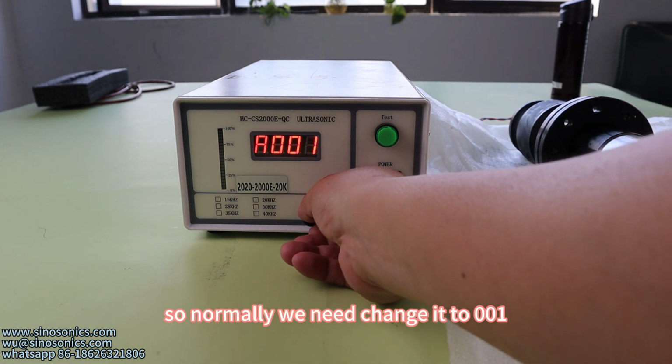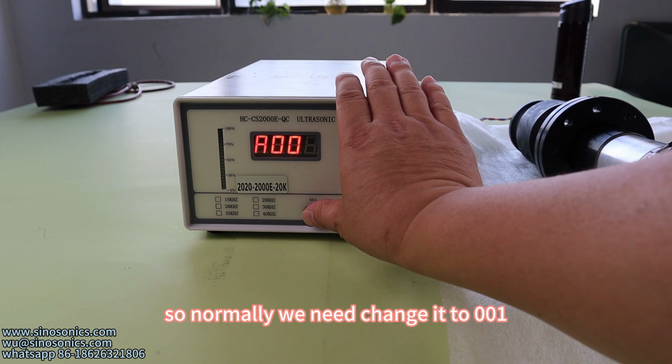So normally we need to change it to 001.